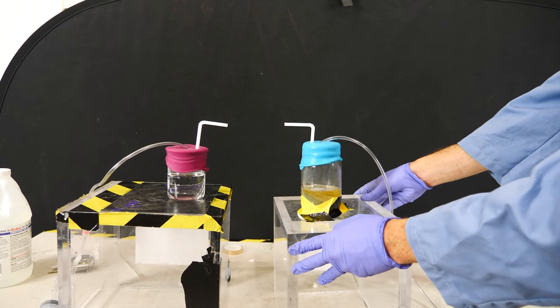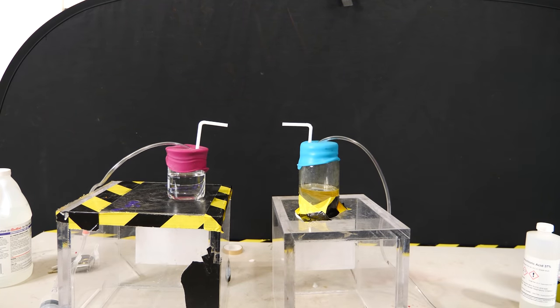In the jar with the pink lid, I have ammonia. In the jar with the blue lid, I have hydrochloric acid.